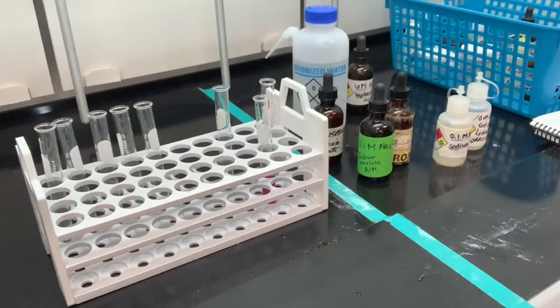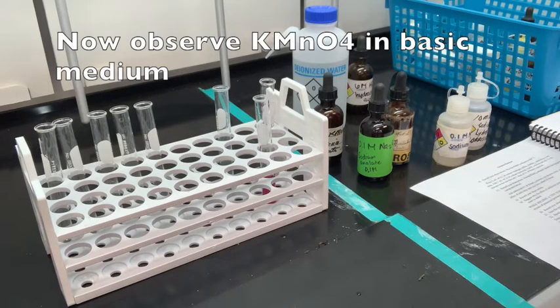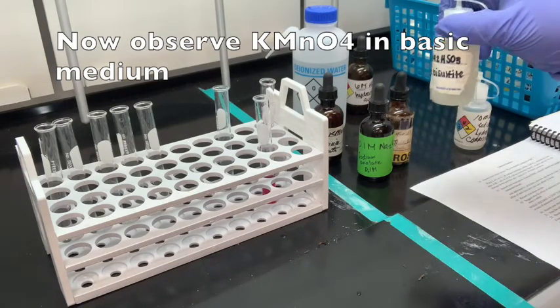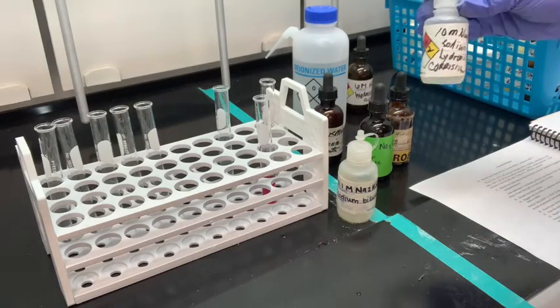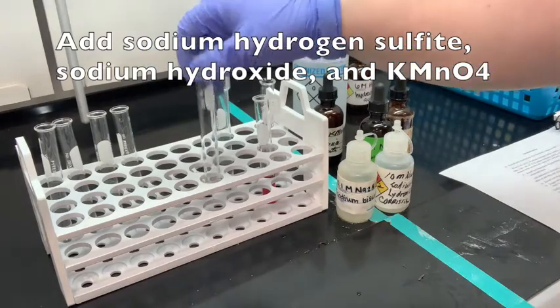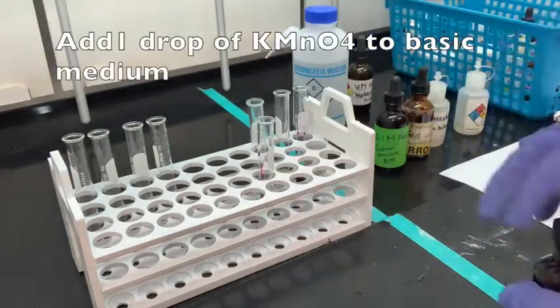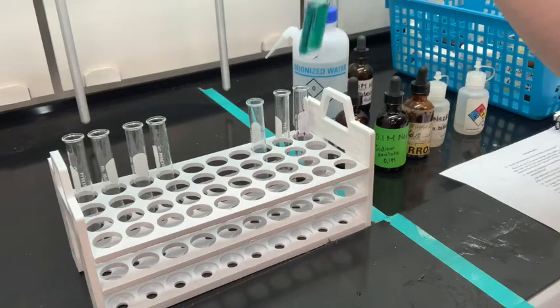The next reaction with permanganate: we're going to add sodium hydrogen sulfite, also called sodium bisulfite, and then see what happens in a basic solution. We'll add sodium hydrogen sulfite plus a couple of drops of sodium hydroxide, which is a base, then add the potassium permanganate. You can see it did not turn pink this time — it has turned green.